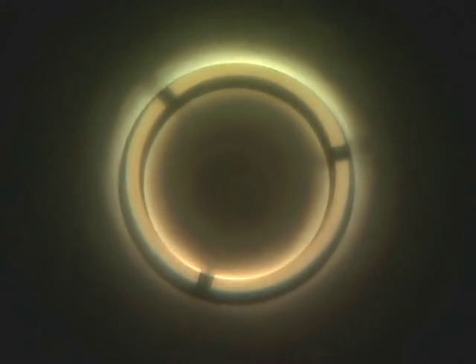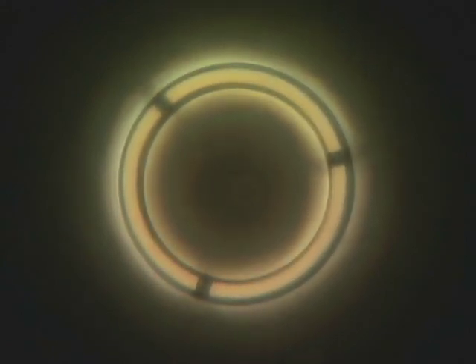The objective is to get perfect phase contrast to look into the centering telescope and to align these rings. And that is what they should look like right there. And when they look like that, we will look at our image and we have great phase contrast.